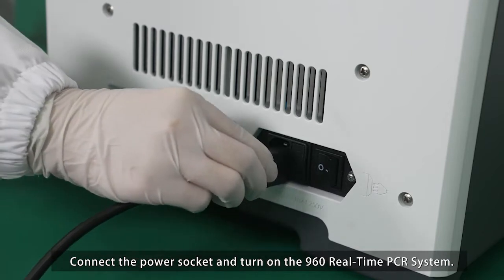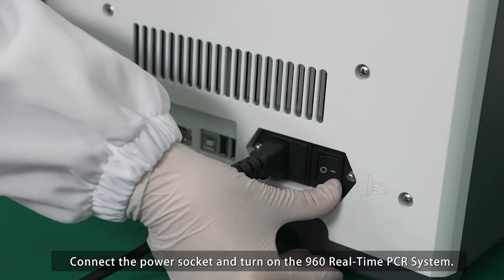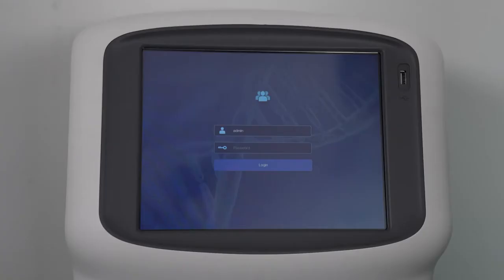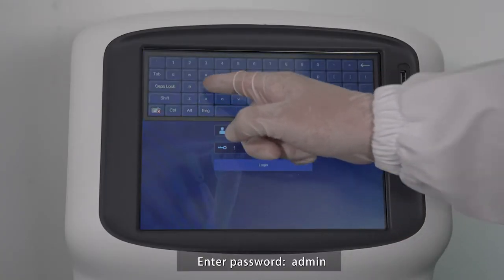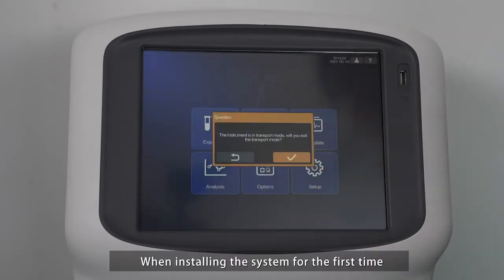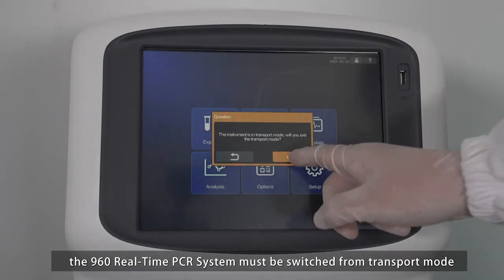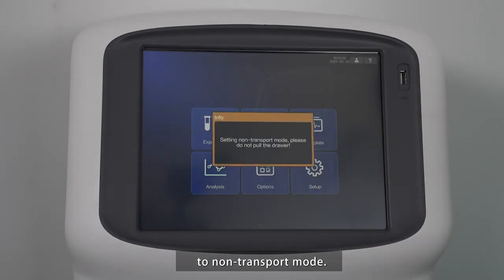Connect the power socket and turn on the 960 real-time PCR system. Enter password, admin. When installing the system for the first time, the 960 real-time PCR system must be switched from transport mode to non-transport mode.